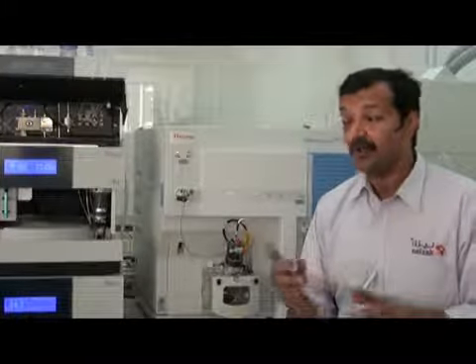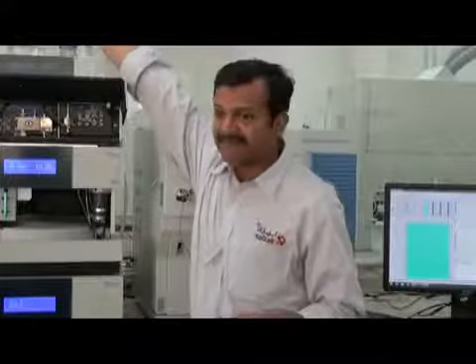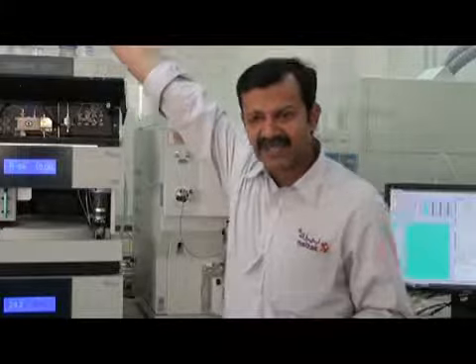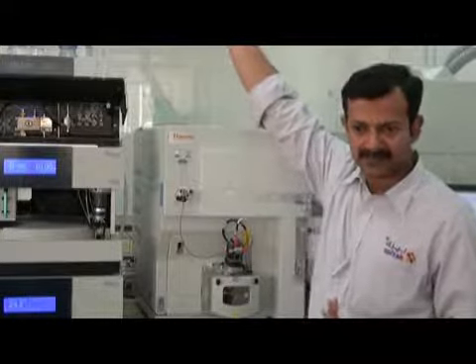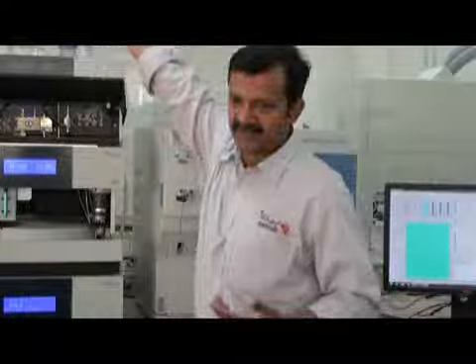So that's why I need... No, if you remove it by A, it means you remove the bubbles from the line from here directly. So you remove it only for line A. Line B is not removed. You have to do line B also. Okay, you have to do it for line B also. The purging starts from here till the end.